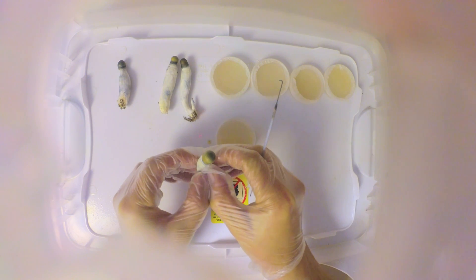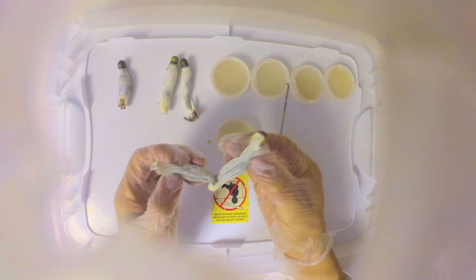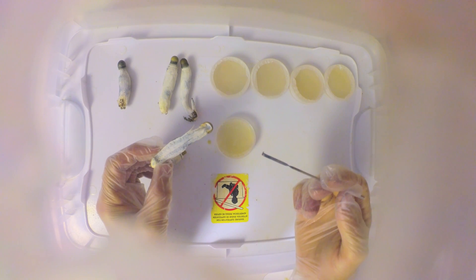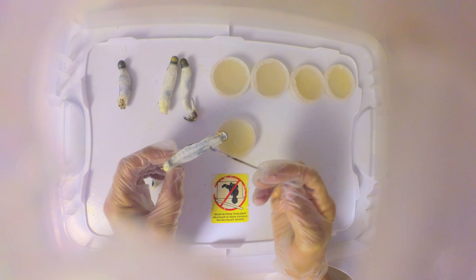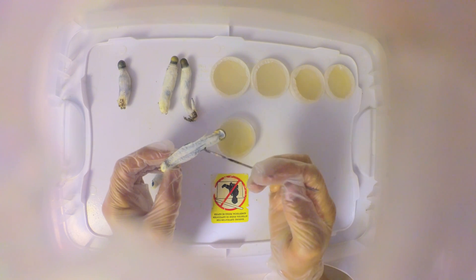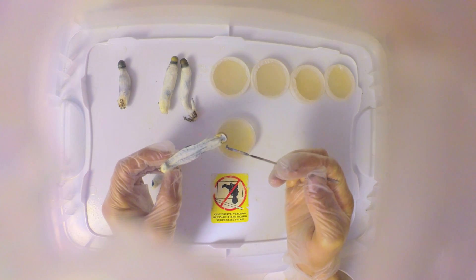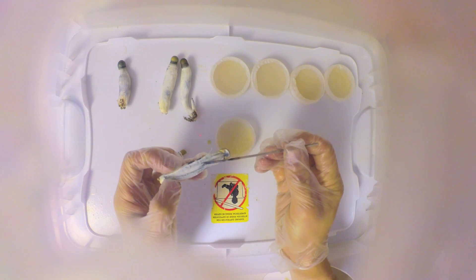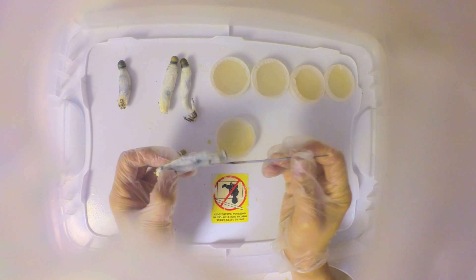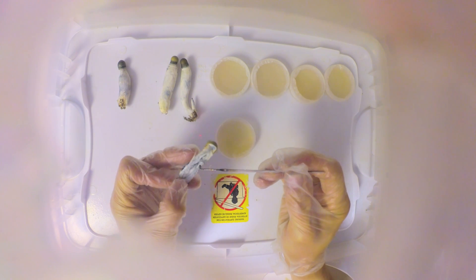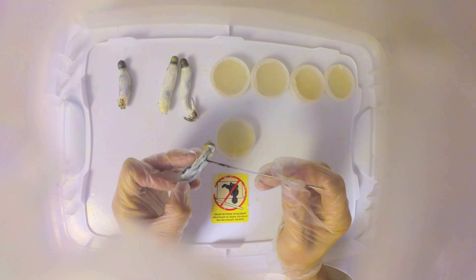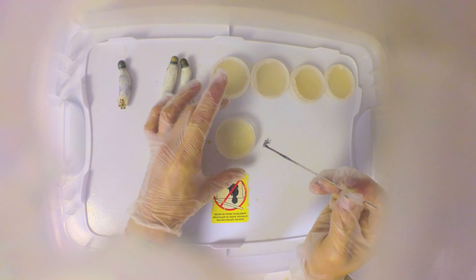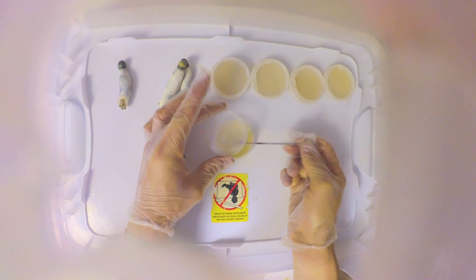As that's cooling, I like to hold it like this so it's not touching anything and stays in the sterile air. You want to rip your mushroom open, and once this cools down you're gonna take from the center of the mushroom, the center tissue. Just scrape it and put that in the center of your petri dish. Take your petri dish, careful not to get your fingers over it, and just place it right in the middle.